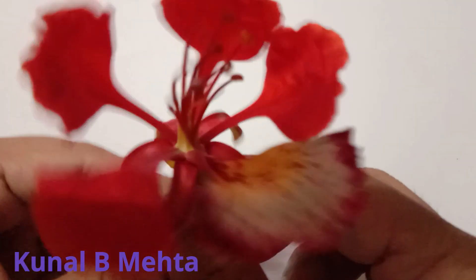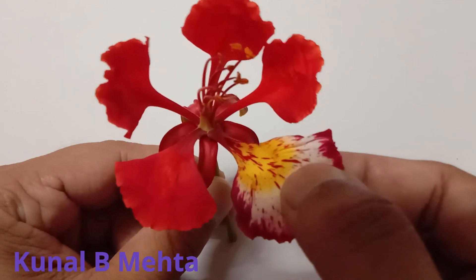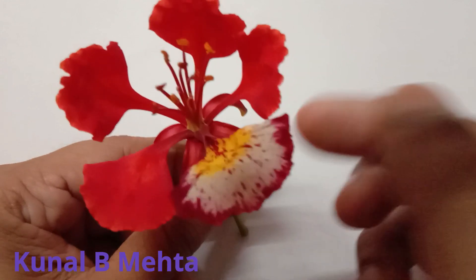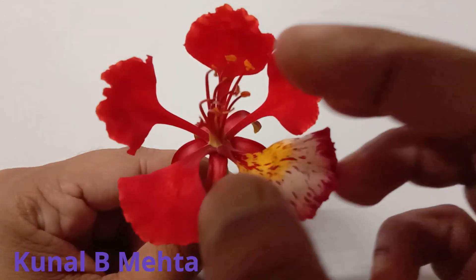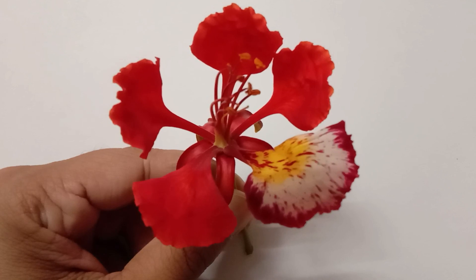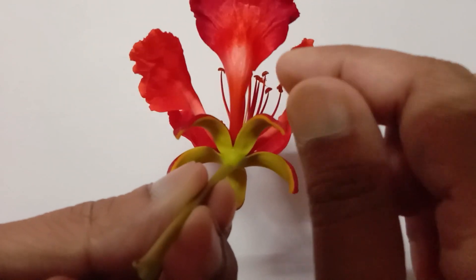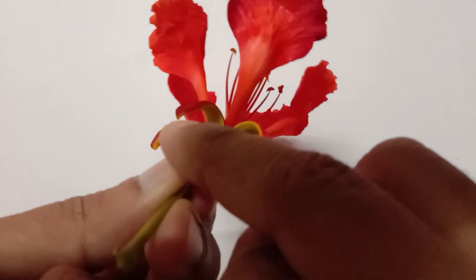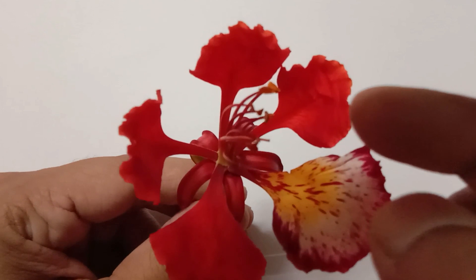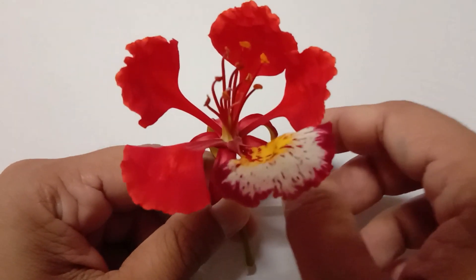These beautiful leaf-like structures that you see are referred to as petals. This single one is one petal — second petal, three, four, five. So there are five petals in each gulmohar flower. As well, there are five sepals: one, two, three, four, and five. So five petals and five sepals are there in all gulmohar flowers.